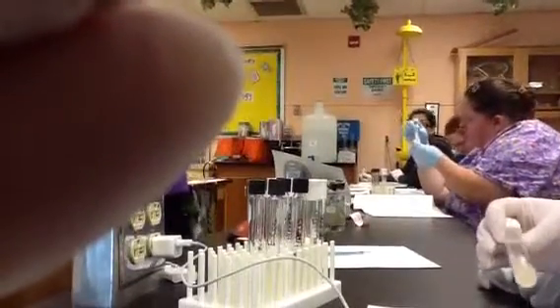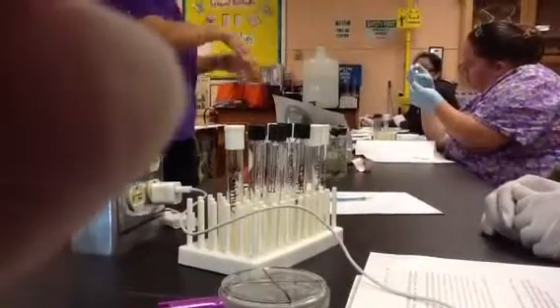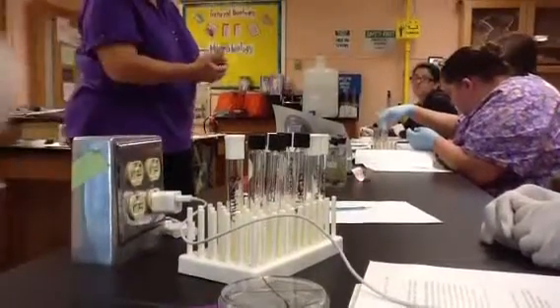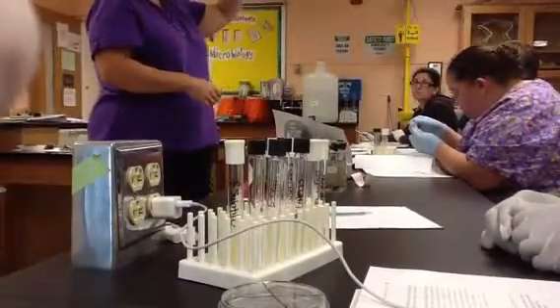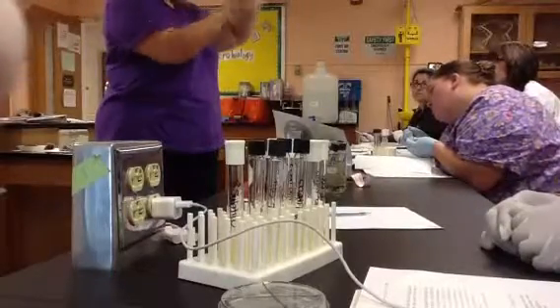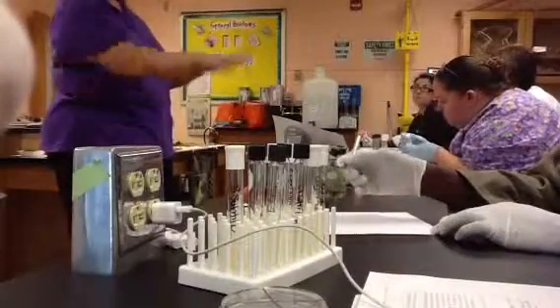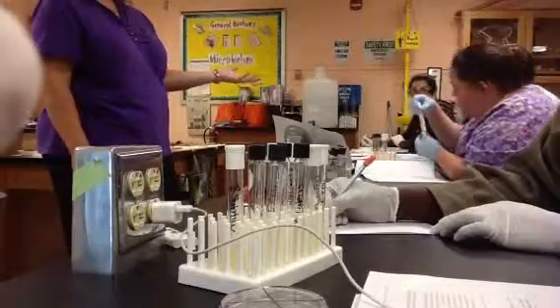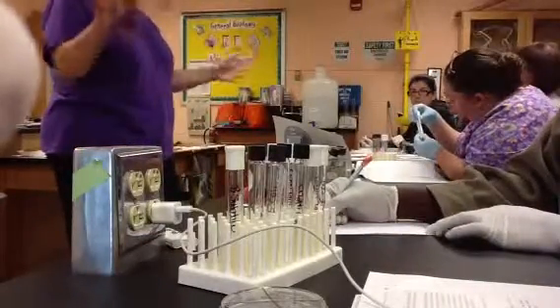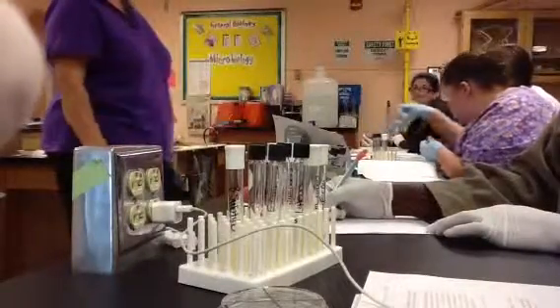For your quiz or your test, I'm never going to ask you whether Bacillus was pellicle or flocculent or turbid. I'm not going to ask you which specific bacteria had which specific characteristic. I'm more interested that if I held up this tube and asked you what it was, you can tell me it's turbid, or that it had a pellicle if there was one in there. So don't waste time learning which bacteria is which. Just try to identify examples of each. When you're finished with them today, bring them up to me at the front and I'll collect them all for the waste container.